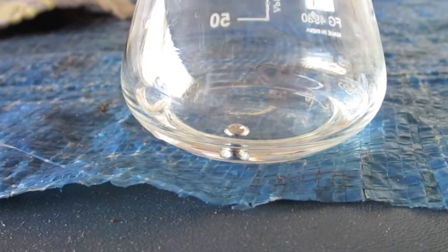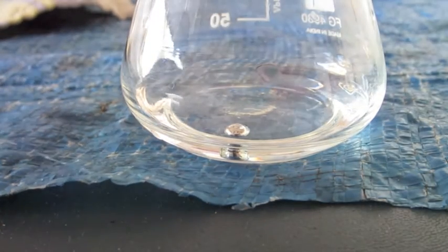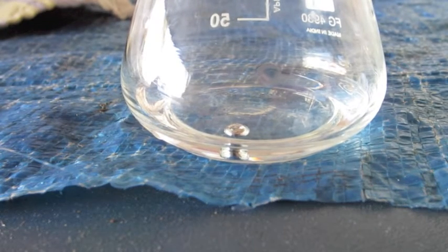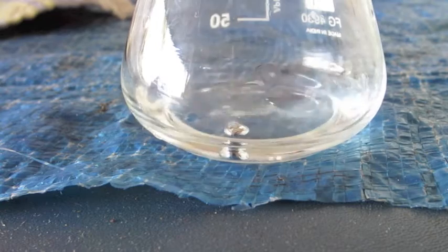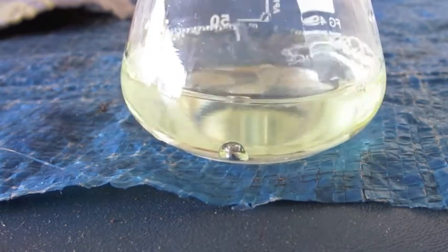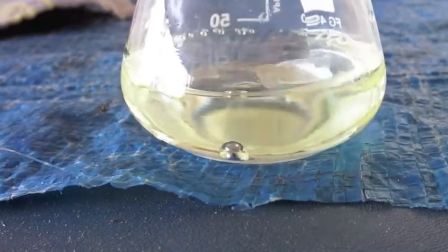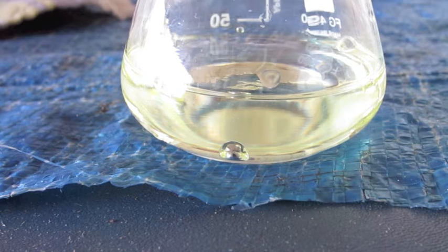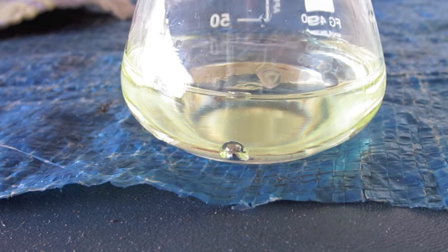Okay, this is nitric acid, and I'm about to add some hydrochloric acid, and then the resulting acid will be the king of the acids, aqua regia. That dissolved gold. Let's see if it can dissolve, or react with, rather, ruthenium. So I'm going to wait a little bit of time just to make sure that the ruthenium is not reacting. And, yeah, the ruthenium is not reacting.